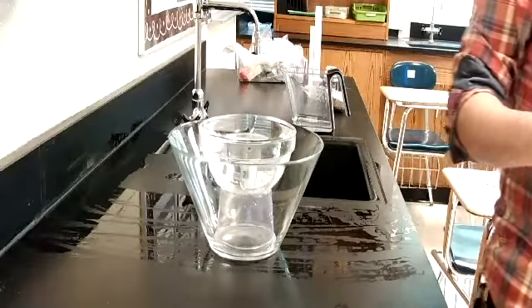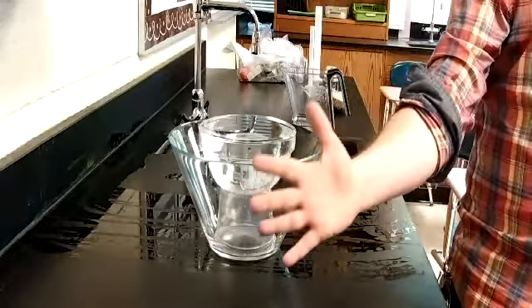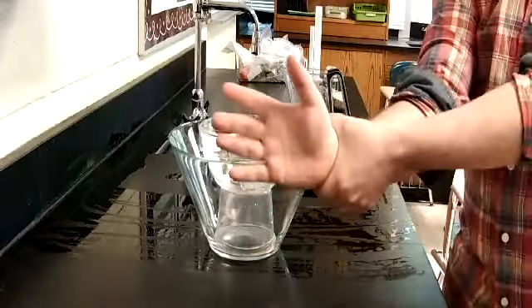So, as a reminder, volume is how big something is. This method doesn't measure mass. You're going to have to get you a scale for that. This is just measuring how big or small the object is. All right. Let's start with a simple object. My hand. I tried that earlier. I want to measure the volume of my hand up to my wrist.